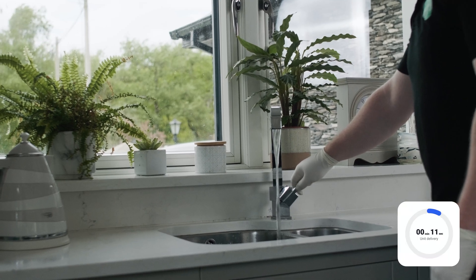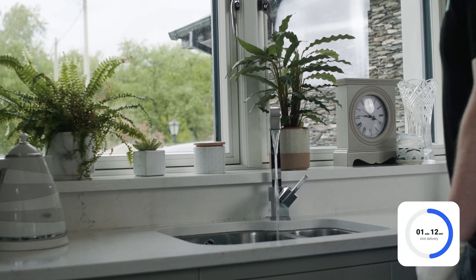Step 3. Turn on the tap at an even rate and let the water run down the drain again for 2-3 minutes.